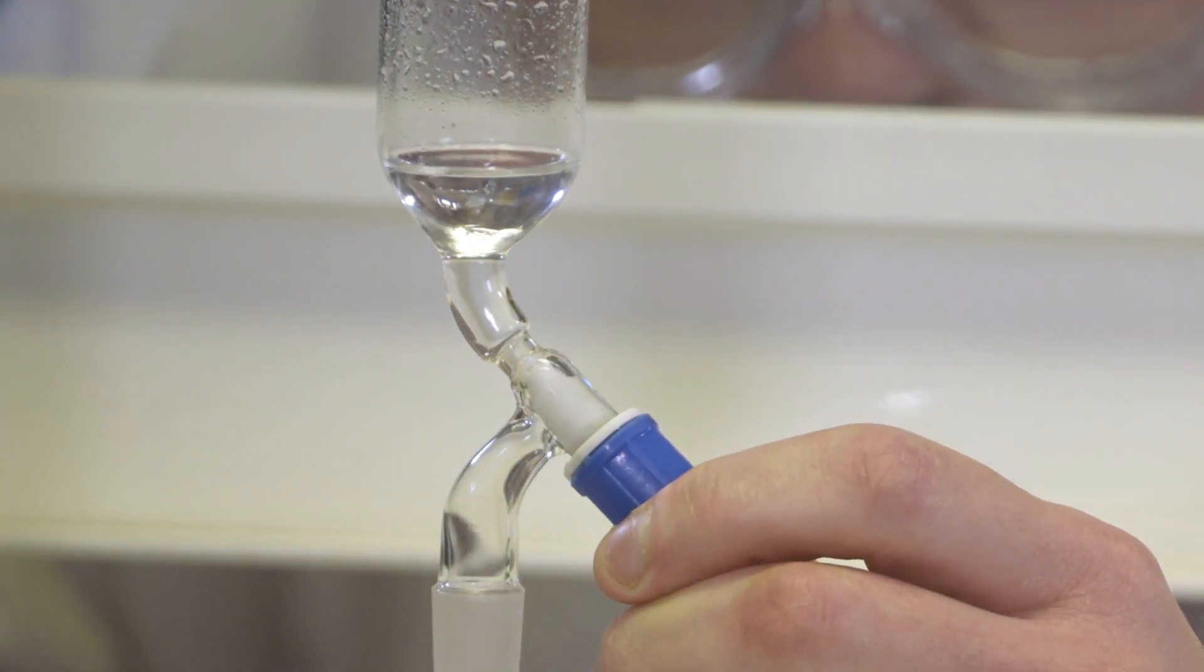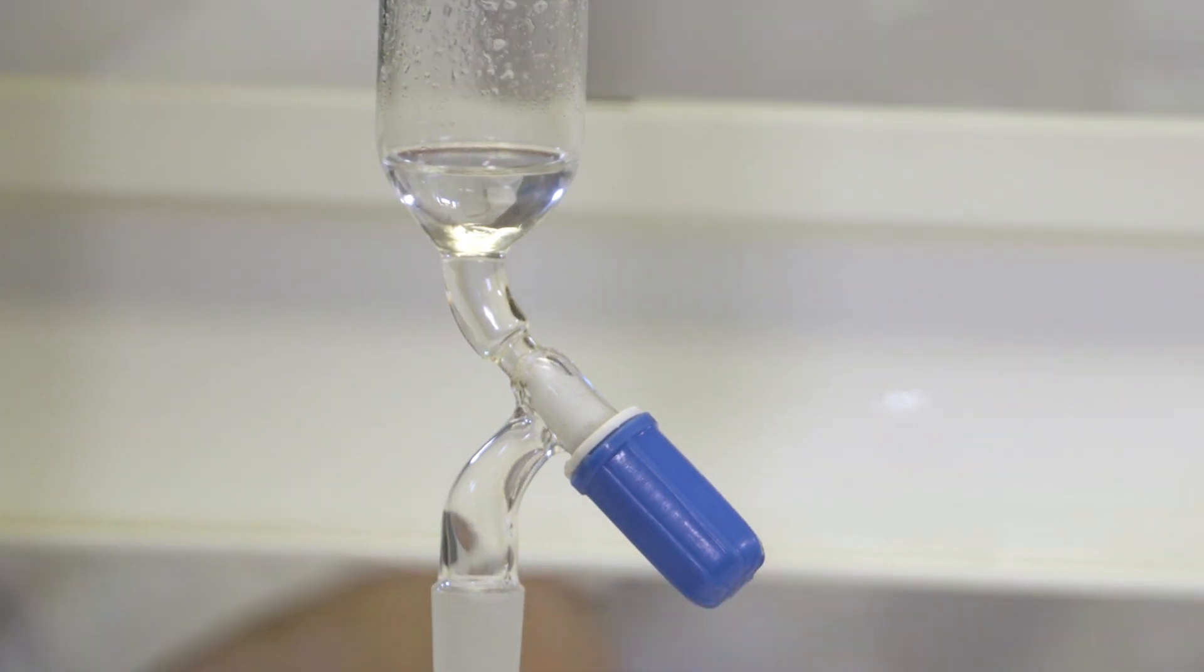Now, we have completed the initial separation of our organic product. The next step is to purify this sample.